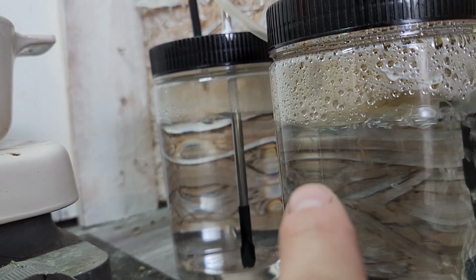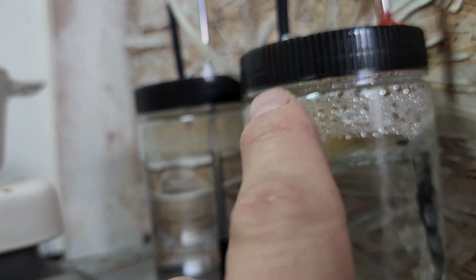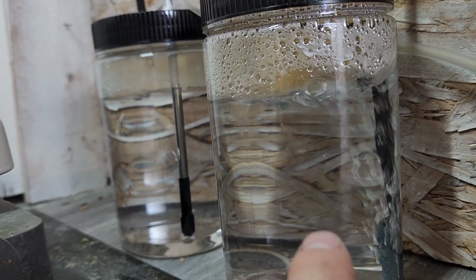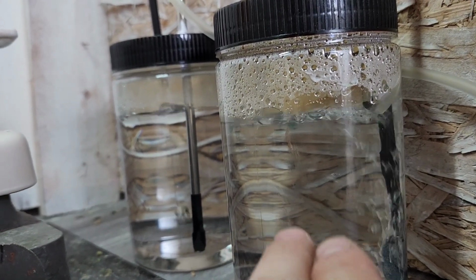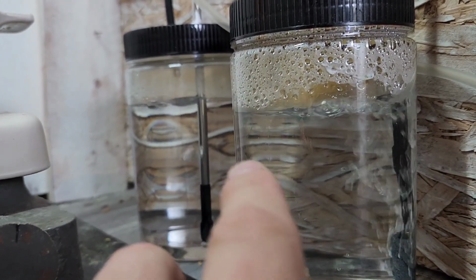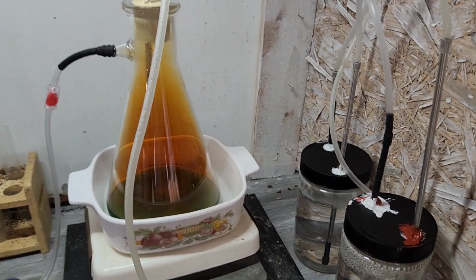So I'm going to have to get something that I can easily seal 100%, not worry about. And two, they need to be bigger. So that is my next project. But currently we should be retaining some, or making some nitric with this. So in the meantime, I'm going to continue this when I'm dealing with small projects. But it's not done and it needs some more work. So looking forward to keeping you guys in the loop with how this project comes along.